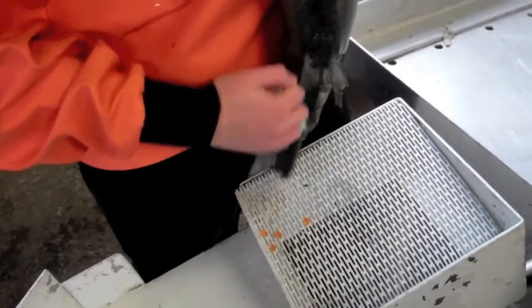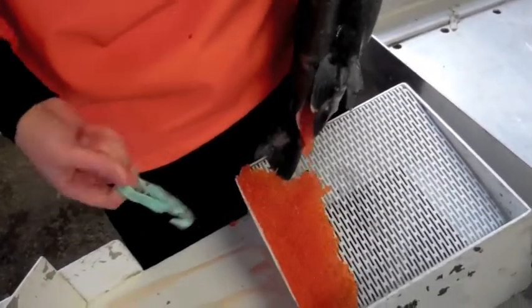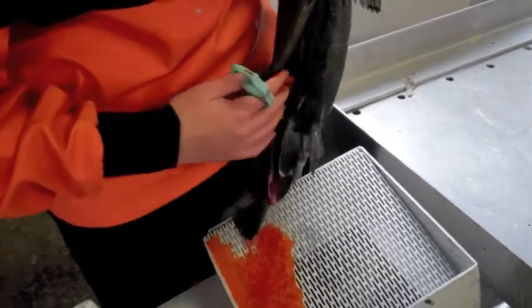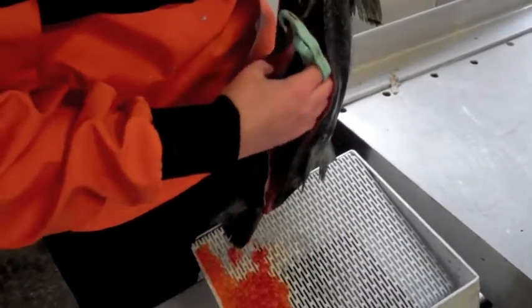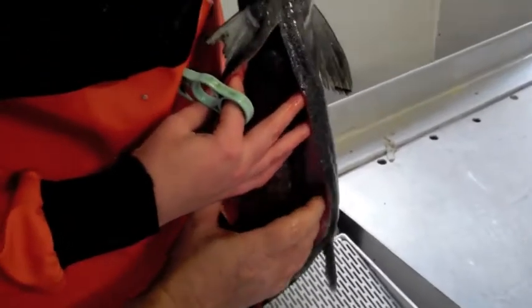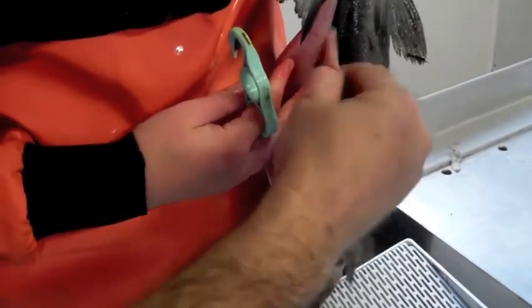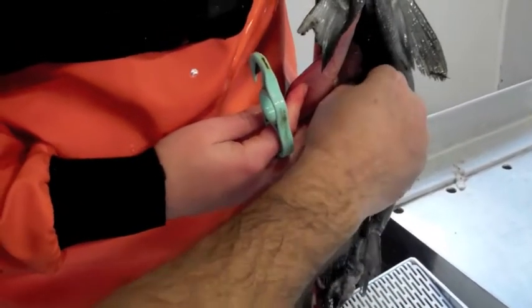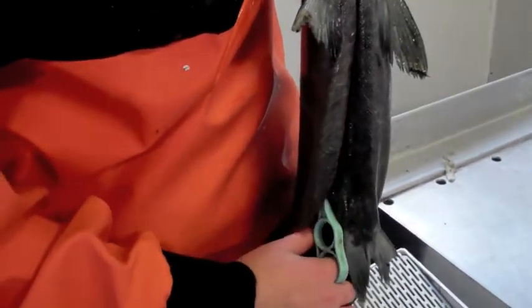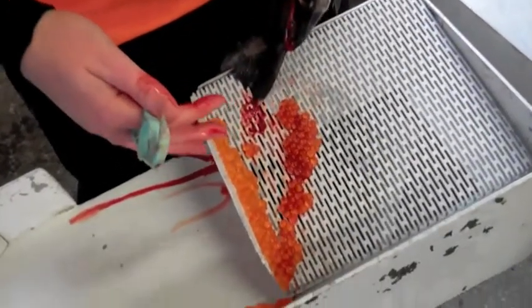You do it to pull hard — sometimes you really have to kind of pop it. There you go, you got it. Once it gets started it's not that bad, and you can even just set the knife down if you want. That's it. Now just grab that skein between your fingers. See all that membrane there? Grab that. I'll hold it open — see this? That's the skein, and I like to just grab that with my hand and shake it a little bit, because sometimes you'll get — this one's nice and ripe, so the eggs have all come right out. There's a balance between how long you take doing that and how much blood you get on the thing. And that's good.